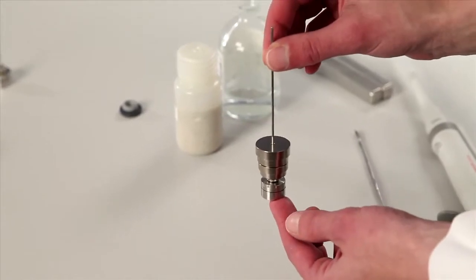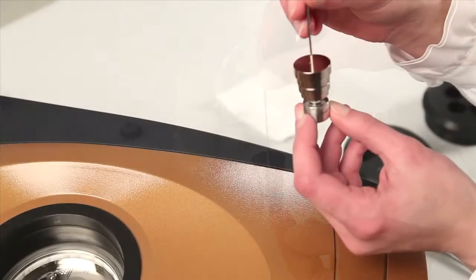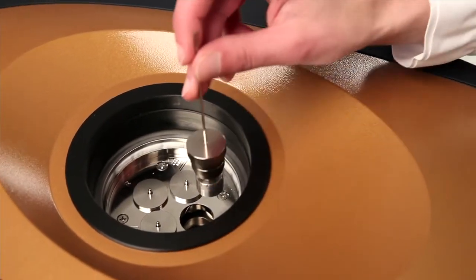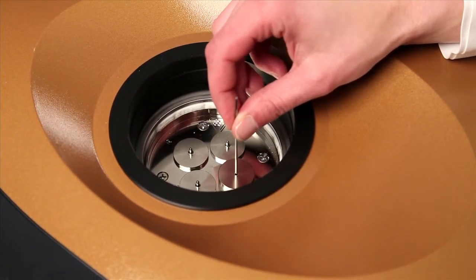And now this entire apparatus can be loaded into the instrument. After the entire apparatus has been assembled with inner shunt and outer shunt sitting on the ampule, this entire piece can be lowered into the unit.